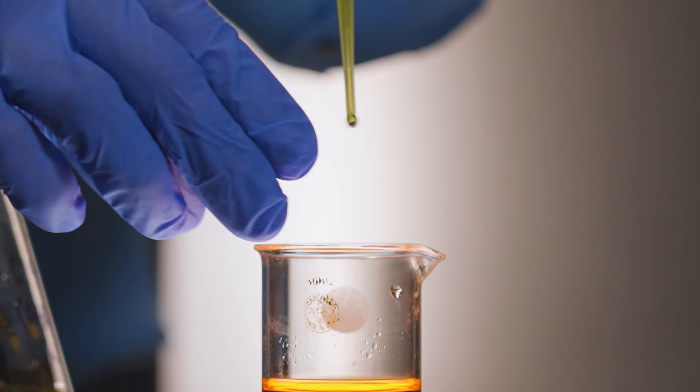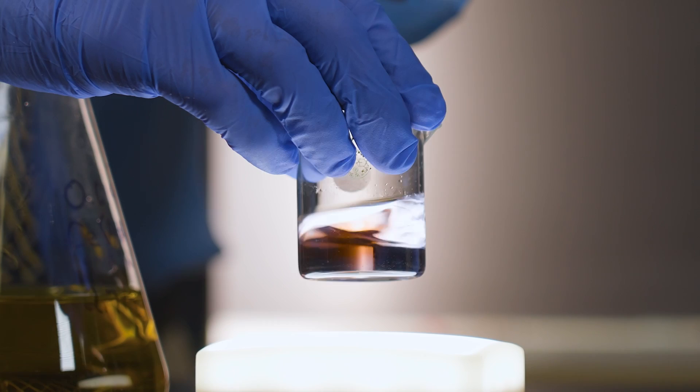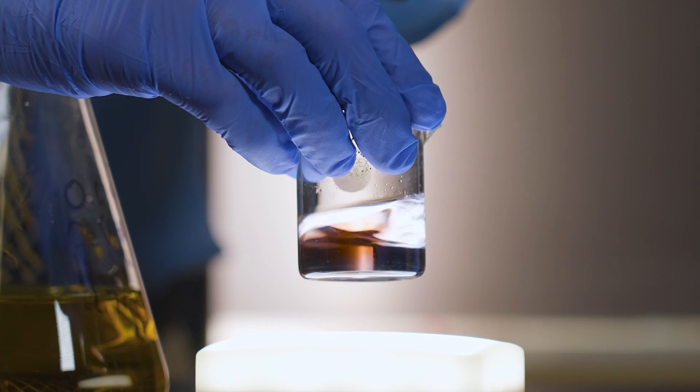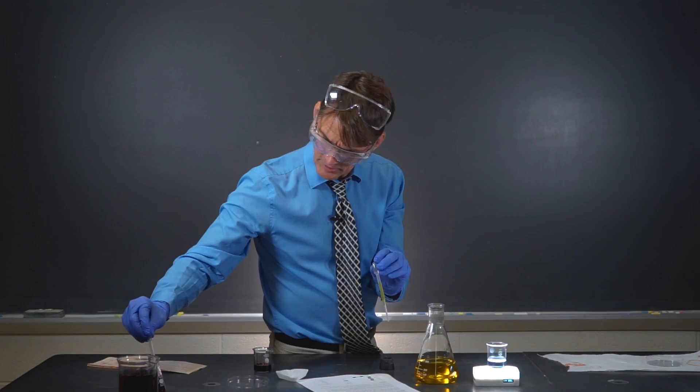And cerium 4 ions are participating in the reaction as well. I'm just going to add a little bit here and see what happens. Oh, there we go. We've got the blue color. Let's add a little bit more of the iron solution to see if we can't get this blue color to pop a little better. There we go.